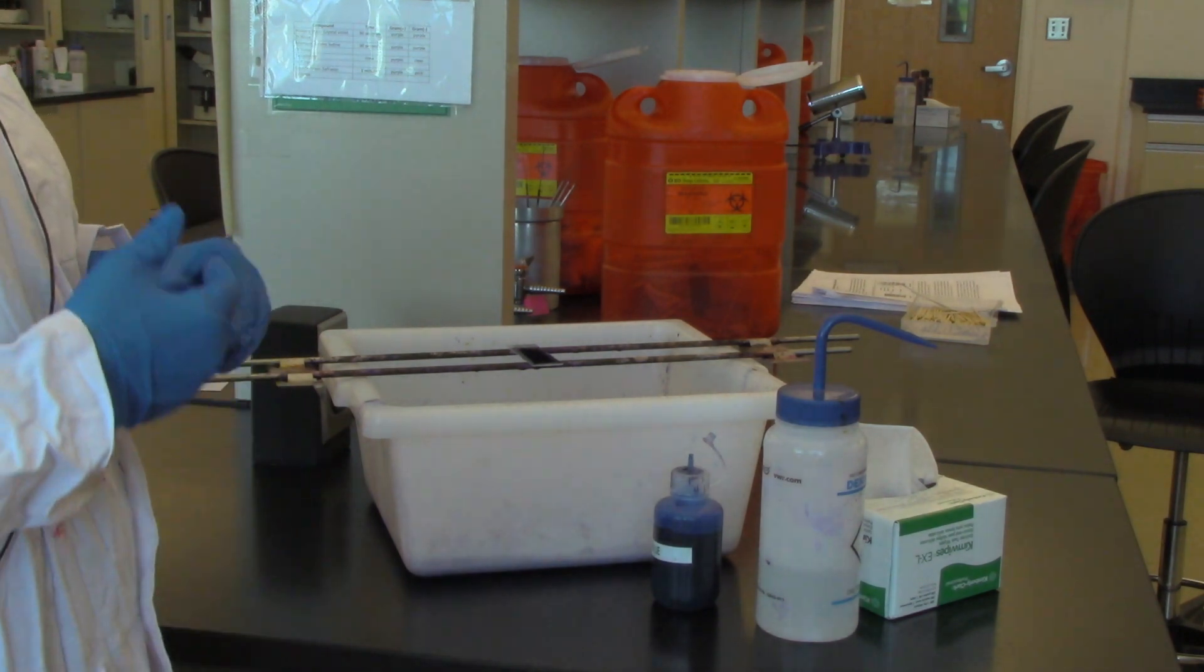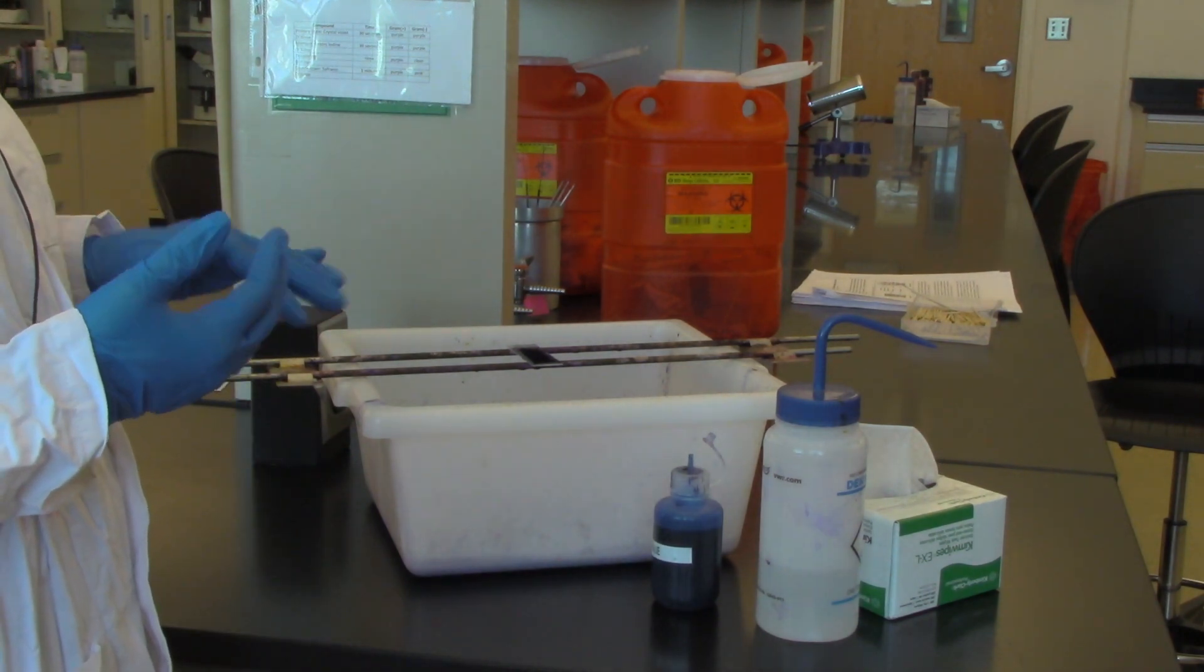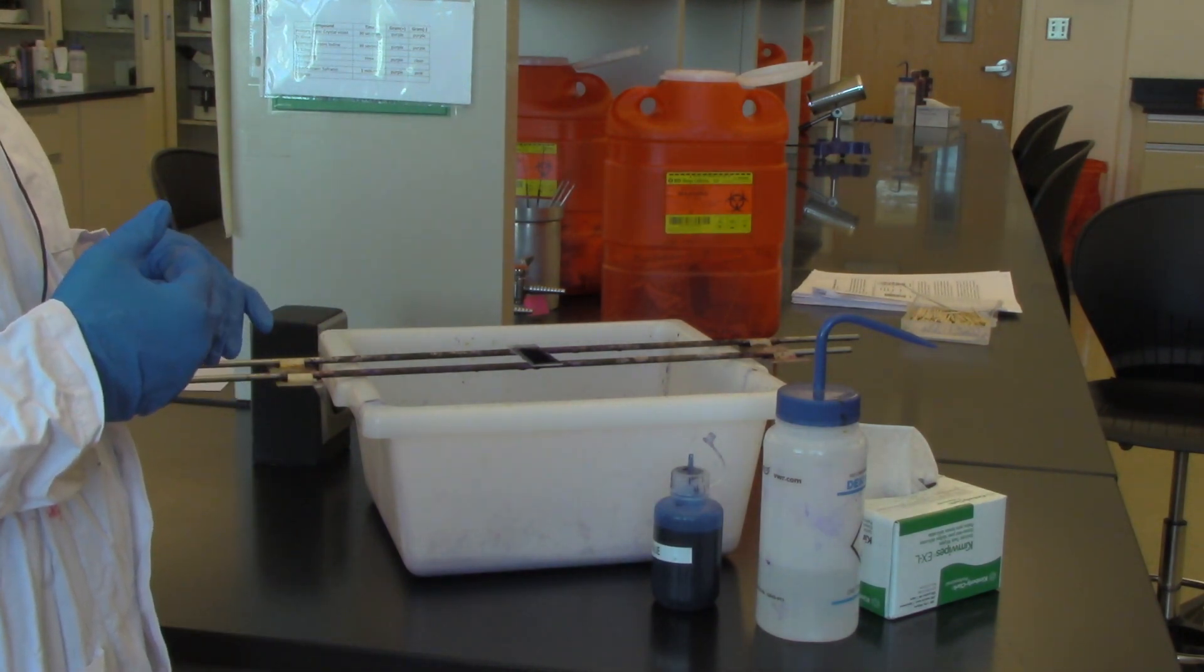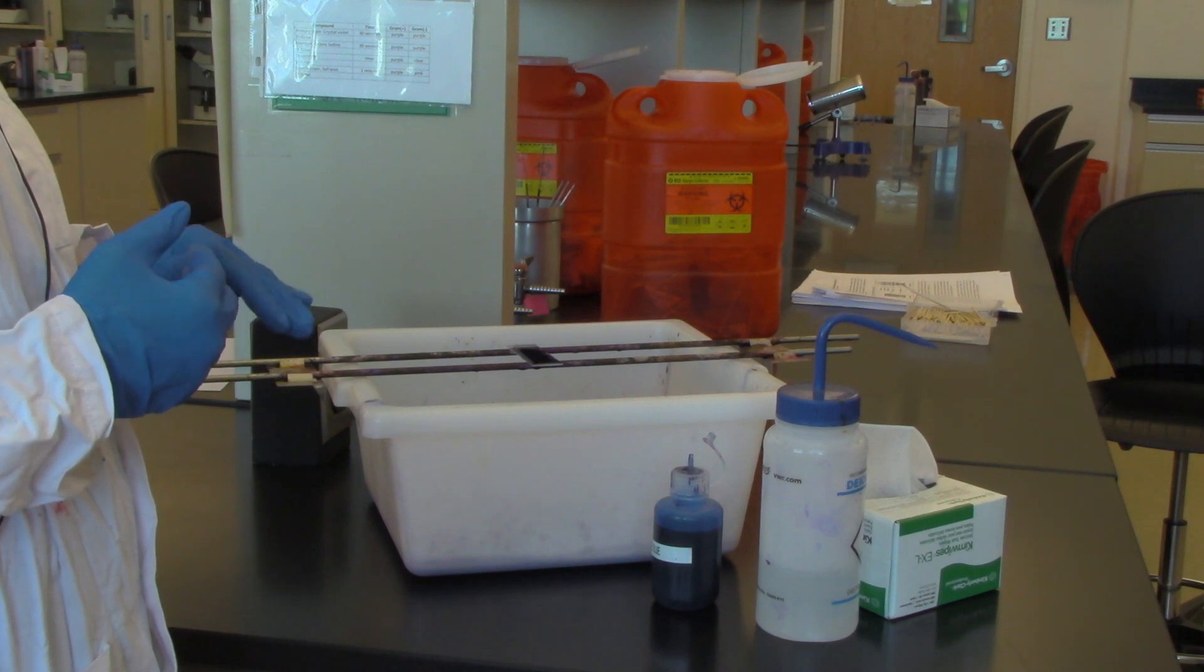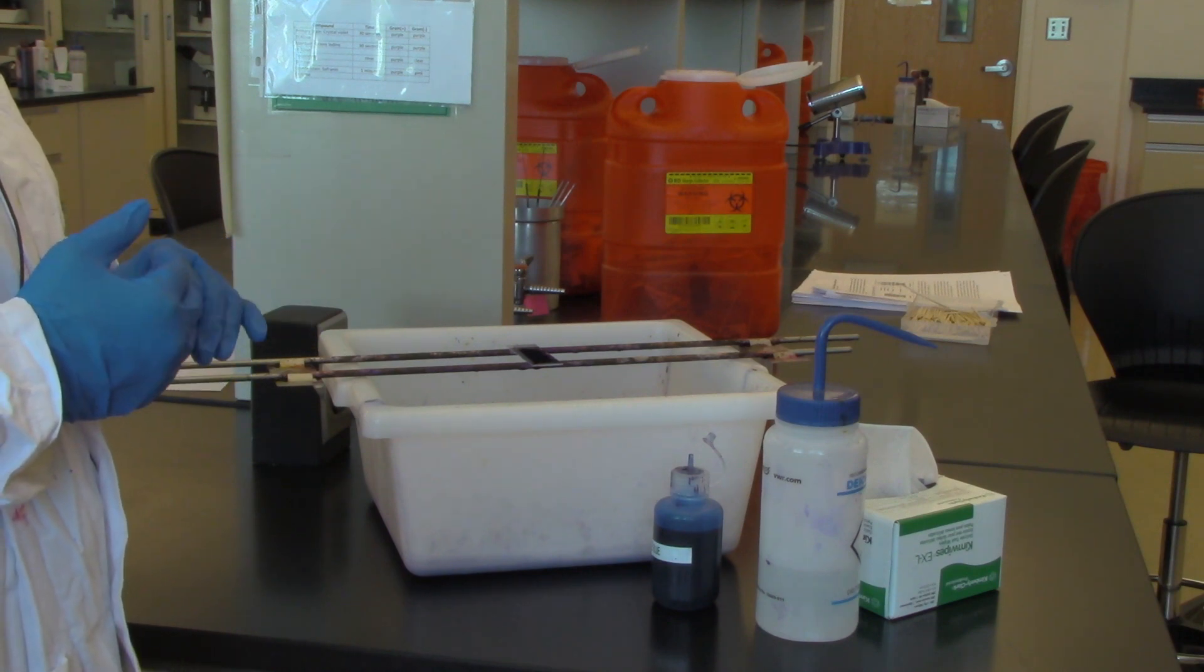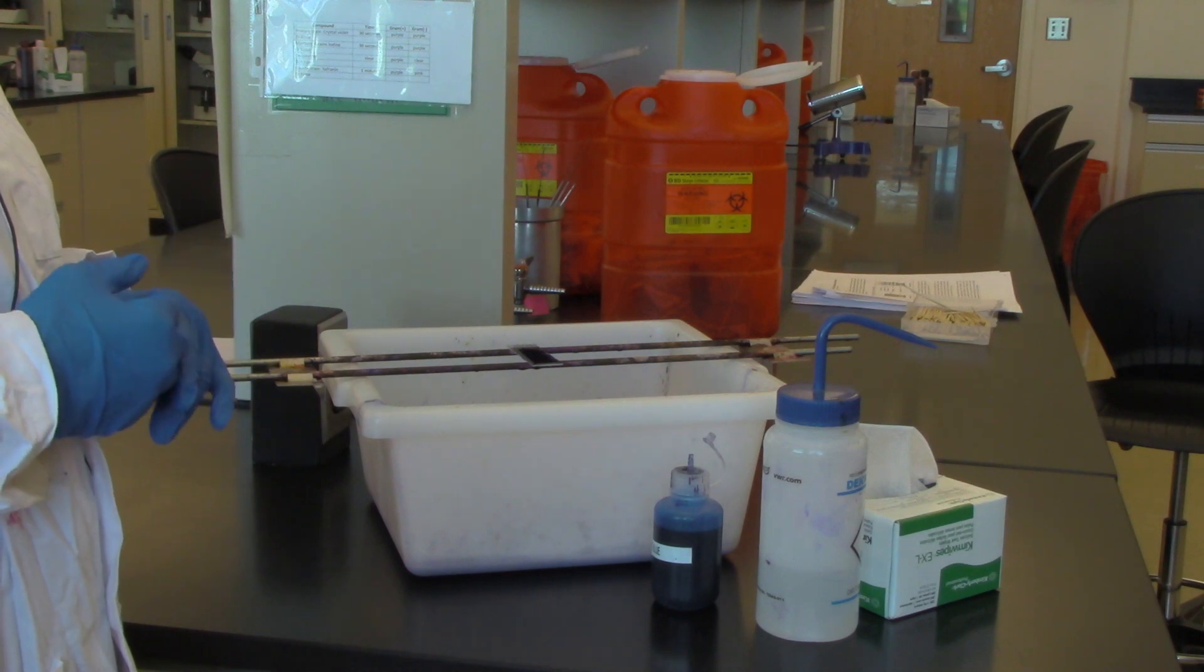That allows time for the stain to penetrate the cells on the slide, and the stain here, because it is basic and it is positively charged, will bind to the negative components of the cell such as the cell wall.